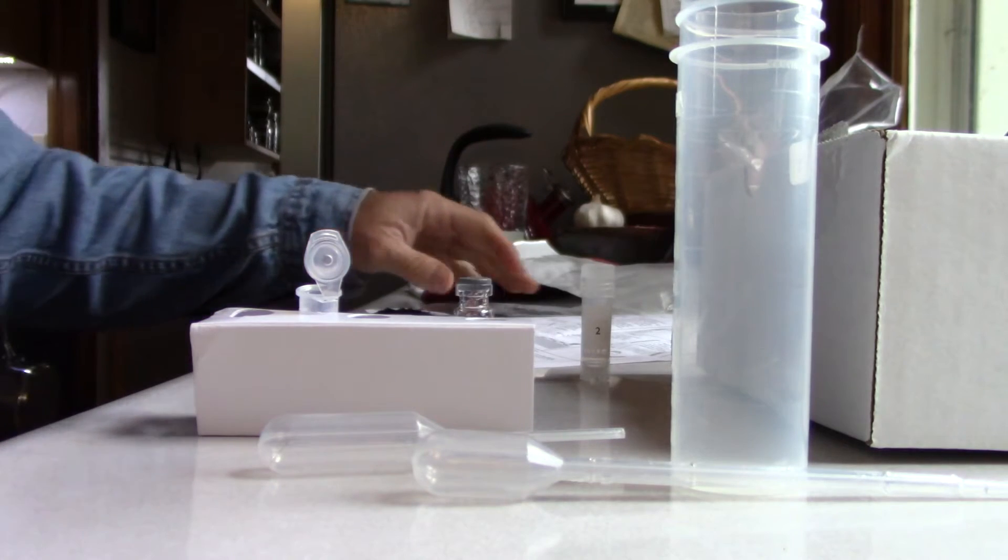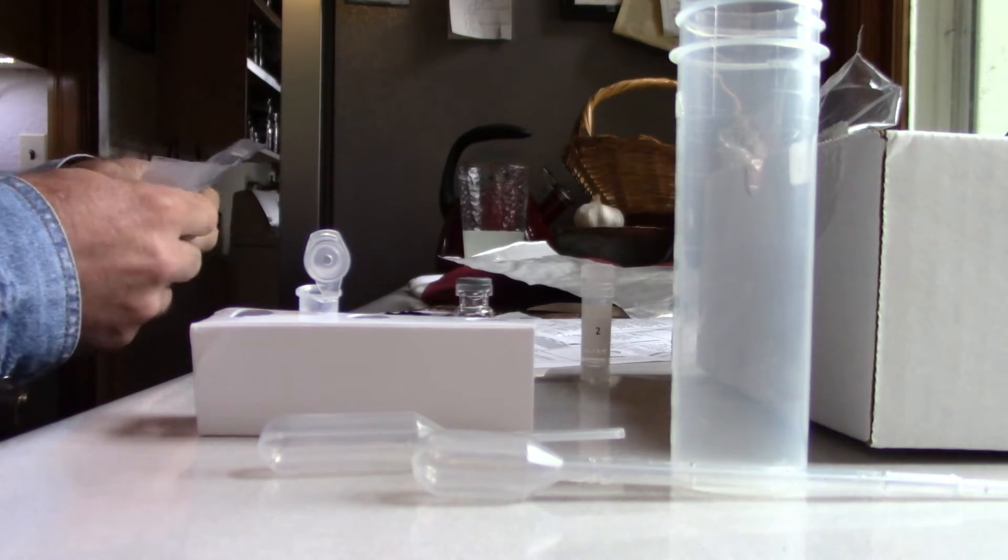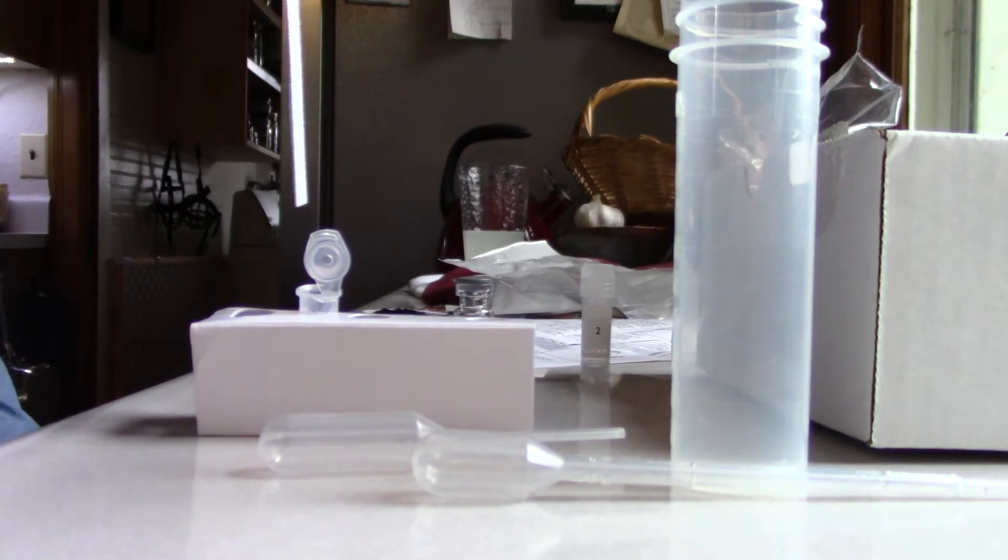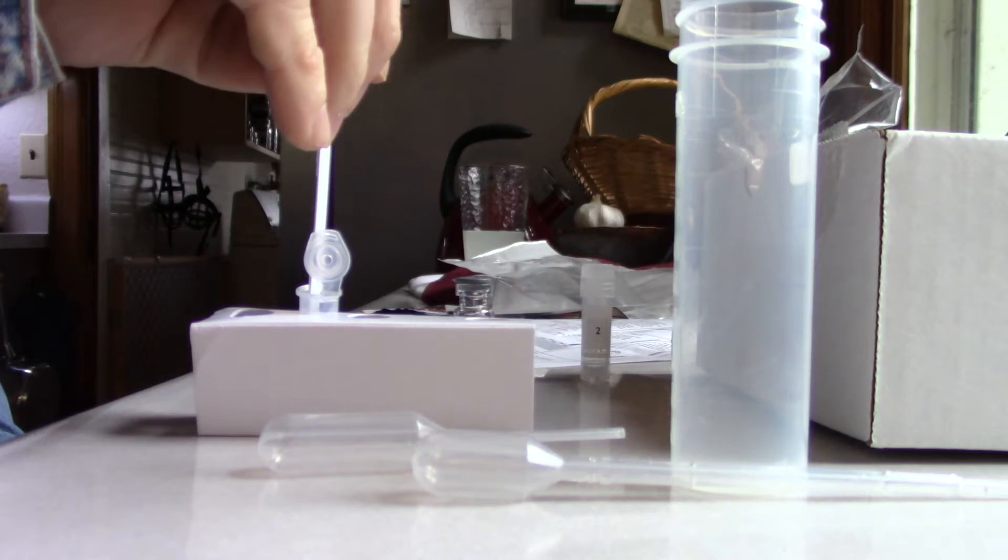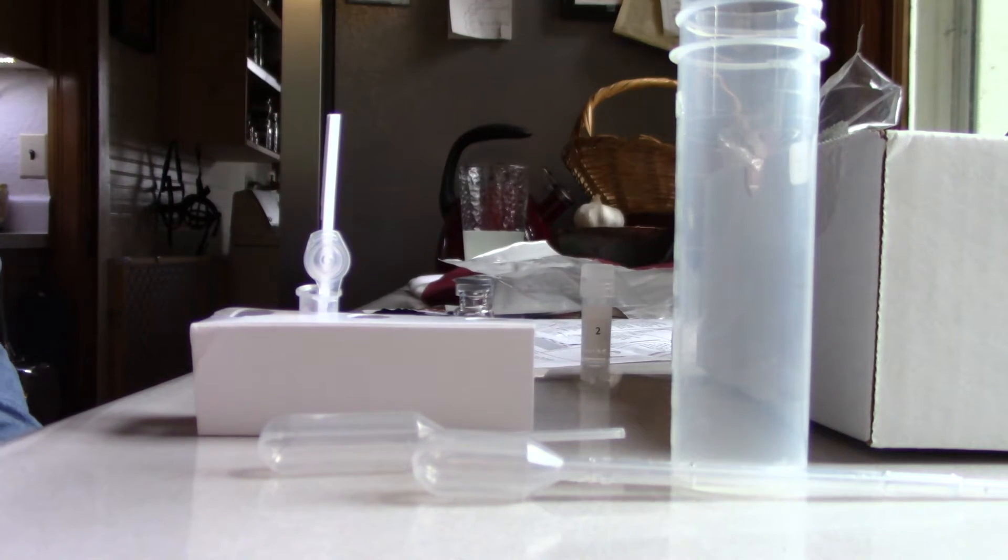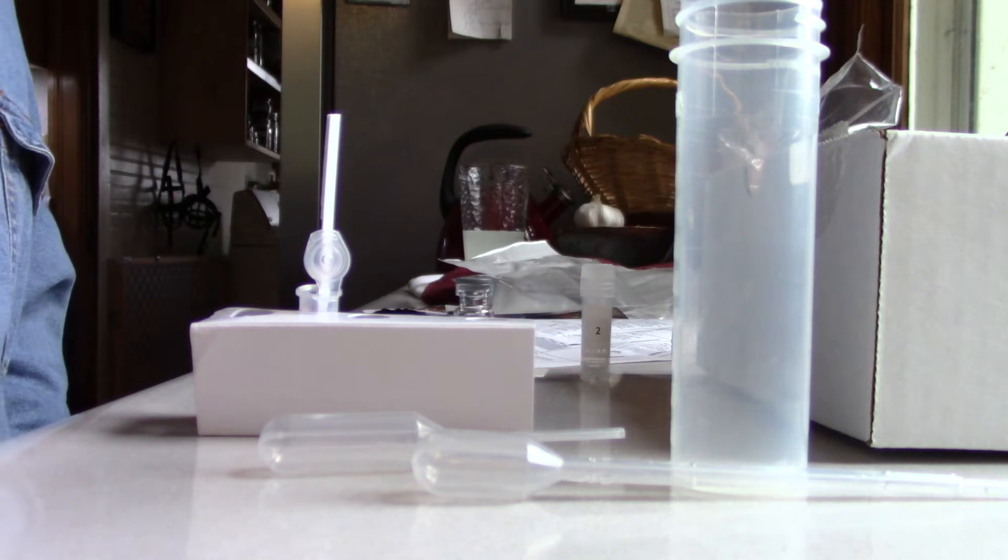Time to insert the test strip. Okay, here we go. Now wait ten minutes. Check in ten minutes.